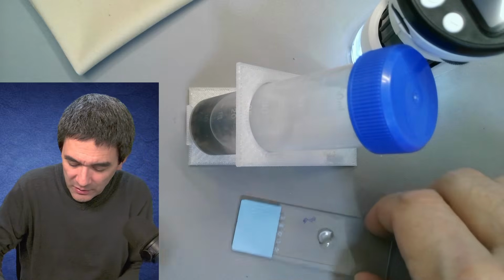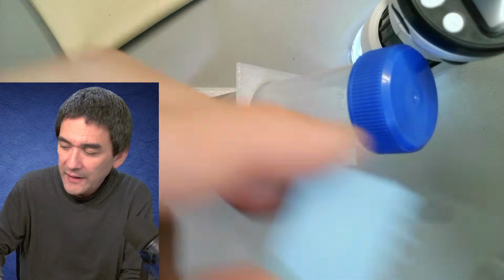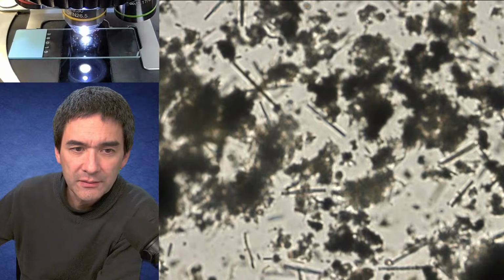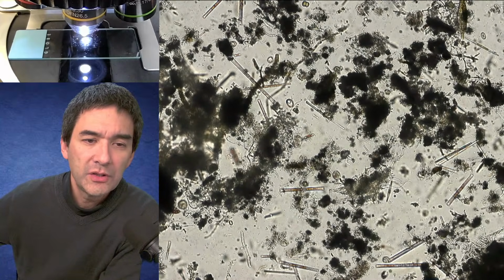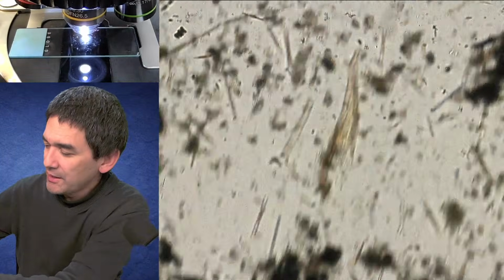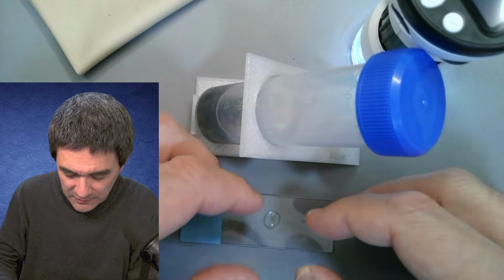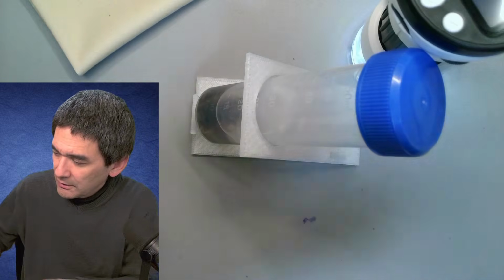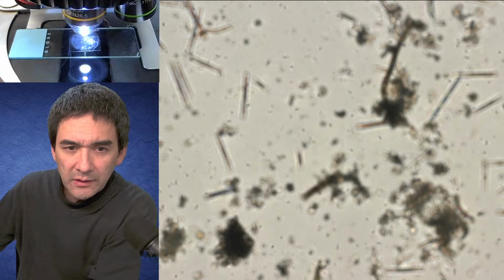I'm going to put the whole slide here directly under the microscope without a cover glass, because I just want to get a general overview of what's present. Okay, you can actually see a couple of little critters floating around here. Lots of diatom shells as well. So there is something there. The cover glass will go on top now, and then we're going to do a proper comparison. I forgot to change here. Here we go. So this is now flat enough to be directly observed.